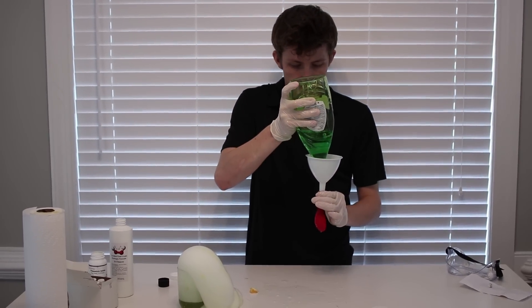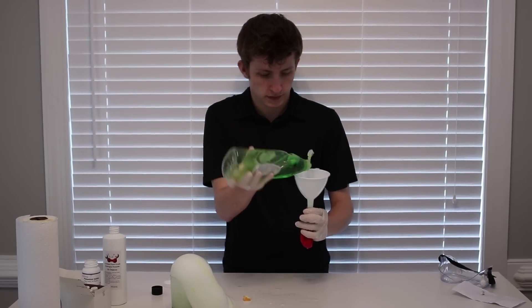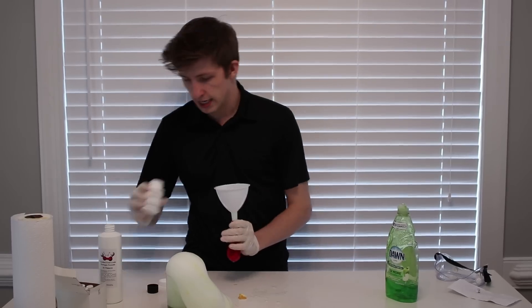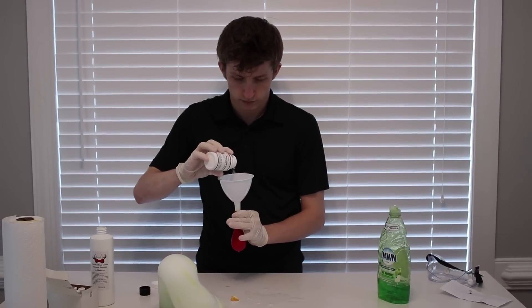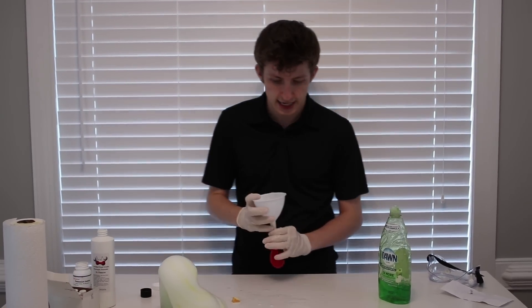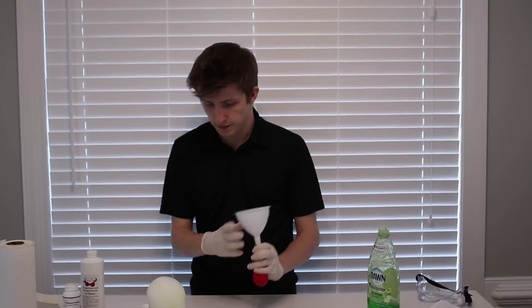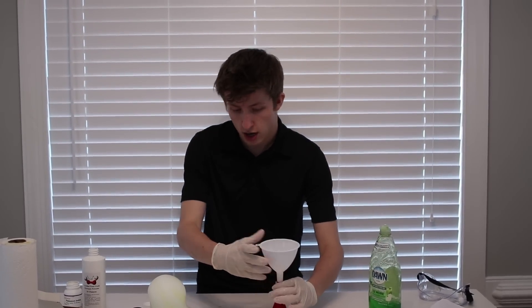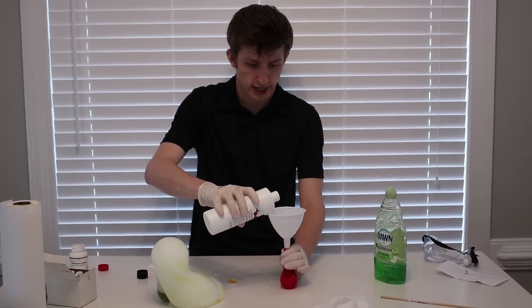So what we'll do is let's put in a decent amount of soap. Not too much. Let's grab our potassium iodide. There you go, potassium iodide is in check. And now, hopefully, let's mix that around a bit. And now we should have a much more violent reaction here. Here we go. Banana Guns, great channel, check it out.